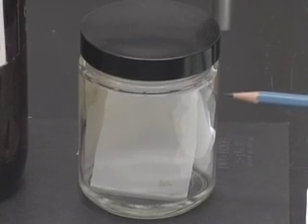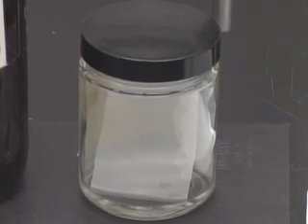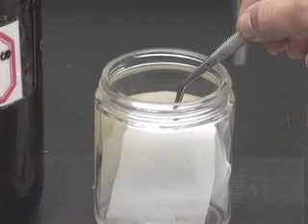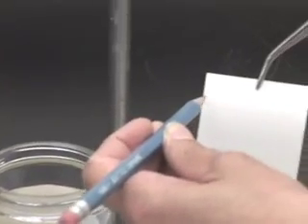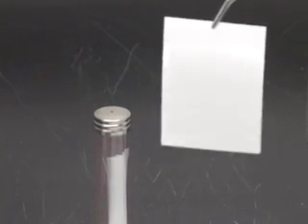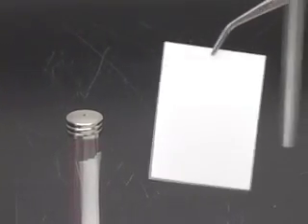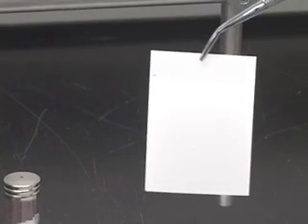You notice that the solvent front has moved nicely to about a centimeter away from the top edge. So I am going to take the plate out and make a mark to where the solvent had moved. Just dry it a little bit by shaking it, and we will cover this developing jar. And now I am ready to take this to the UV light.